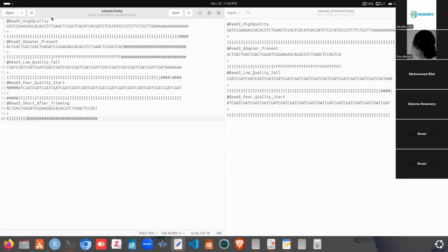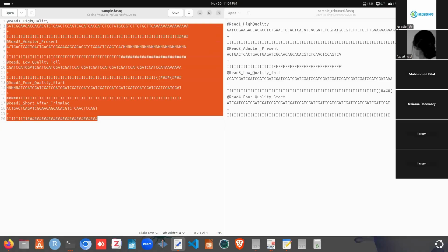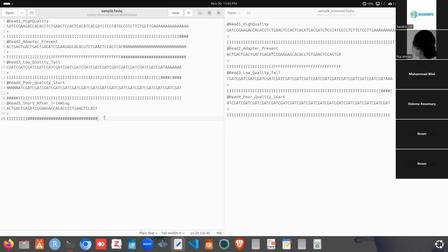Okay, so here we have the FastQ file. This is the original file. In the original file, we have low quality scores. Usually we have low quality scores at the beginning and at the end. For read one, we don't have any low quality scores at the beginning, but we have them at the end. For the second read, we have low quality scores at the end. For the third read, at the end. And for the fourth read, we have low quality bases at the beginning. And for read 5, we have them at the end.